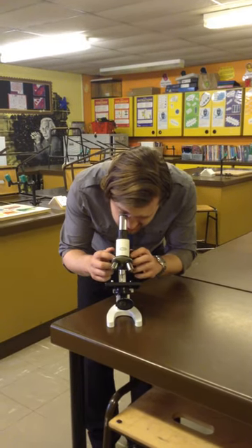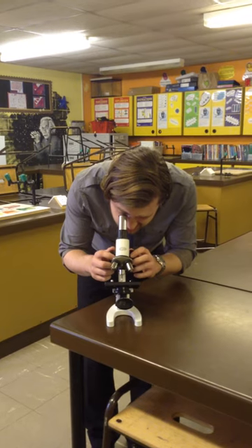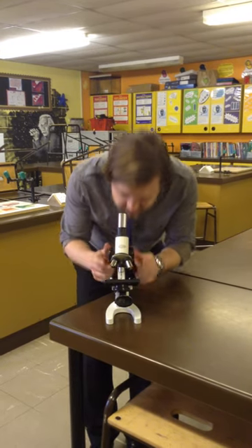Now as the picture comes into focus you can turn them a little bit slower just to make sure and there we go.